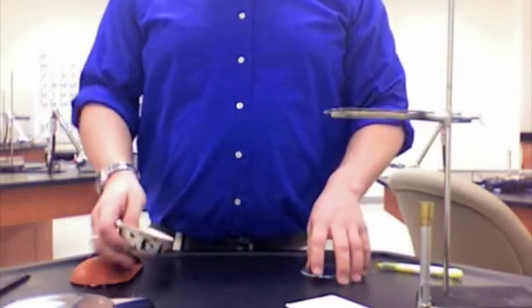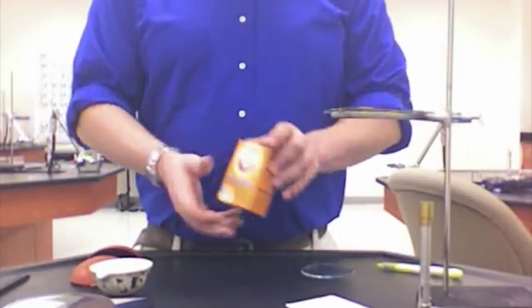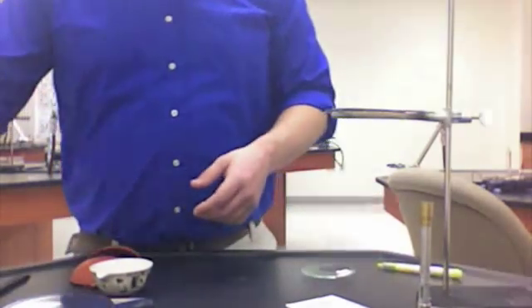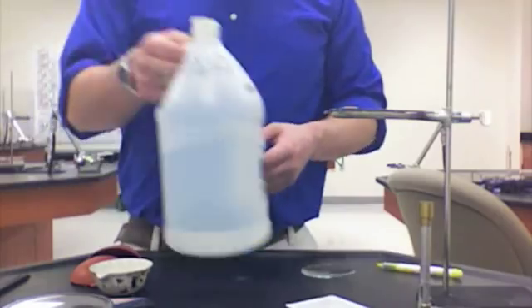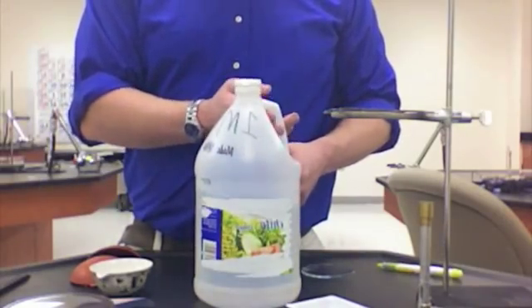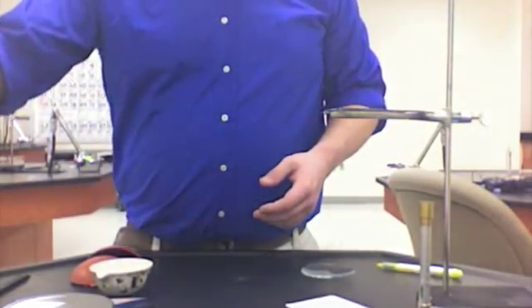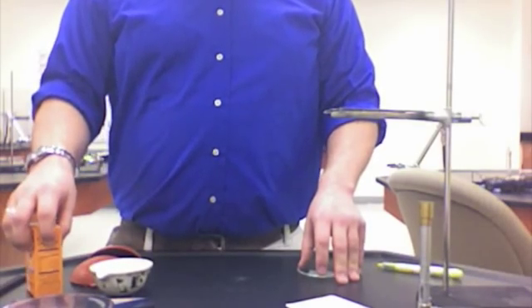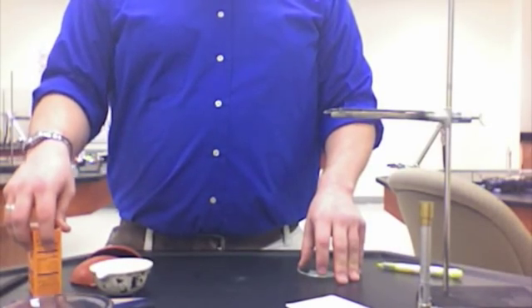The chemicals we're going to be using today are baking soda, which is sodium bicarbonate, and acetic acid, which is just vinegar. What we're going to do today is relate and use this chemical reaction when we mix baking soda and acetic acid in our stoichiometry equations.